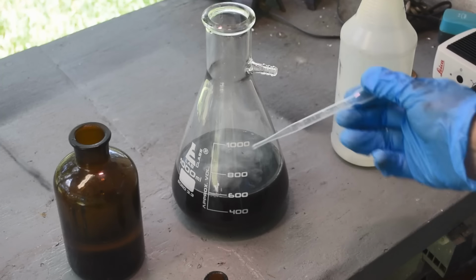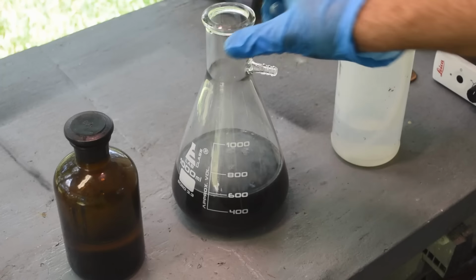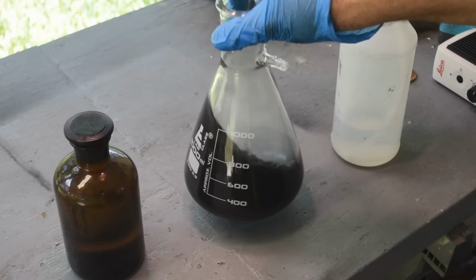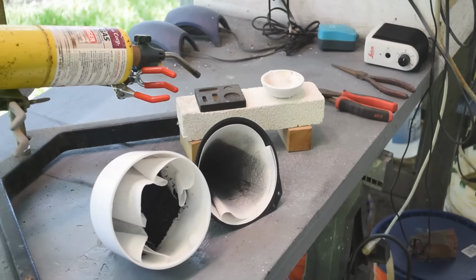Some kind of reaction going on. Reacting with the remains of the ammonium formate, maybe? I don't know. Yeah, I didn't think about that. It might take a little more nitric acid. But we'll just let that sit for a while and see if that looks like it's starting to clear up as the palladium goes into solution.